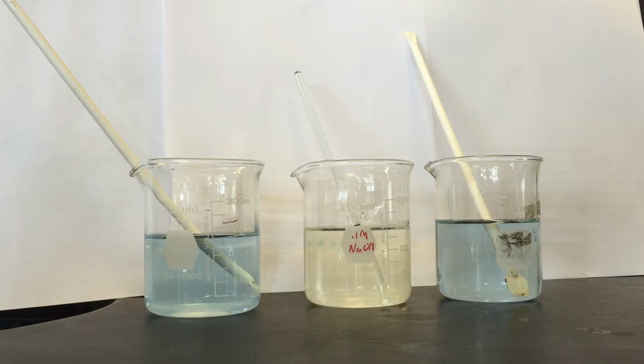Because the color change did not occur in the second beaker at as many, and even double the amount, of drops of hydrochloric acid compared to what occurred in the first beaker, that means that potassium dihydrogen phosphate and dipotassium hydrogen phosphate inhibited the color change reaction and pH change from taking place. Chemicals that inhibit pH changes are called buffers. Thus, potassium dihydrogen phosphate and dipotassium hydrogen phosphate are buffers.